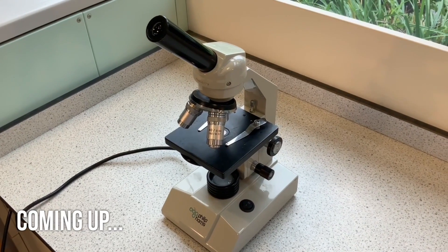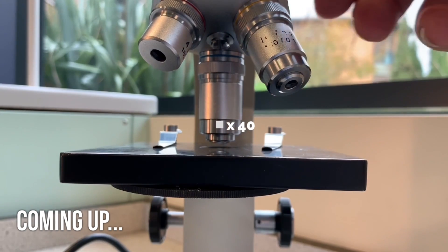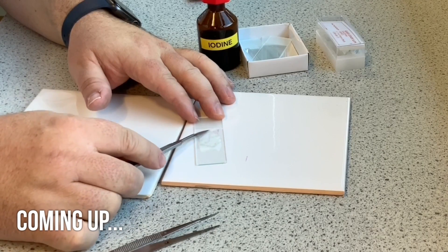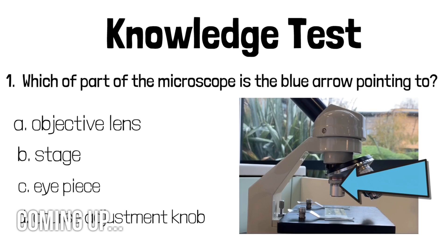This video covers everything you need to know about microscopes for your GCSEs. We look at the parts of the microscope and how to use them, how to prepare a slide, and then draw your observations to get maximum marks. And to help you remember it all and revise, there's a short knowledge quiz at the end.